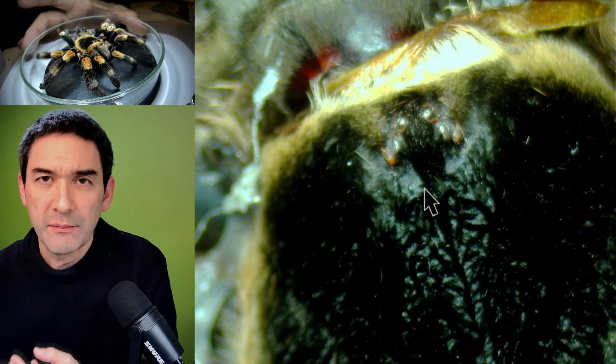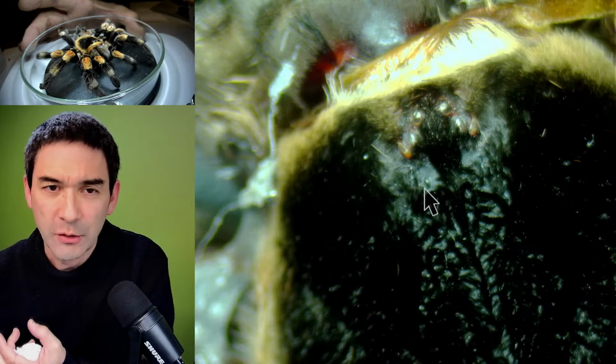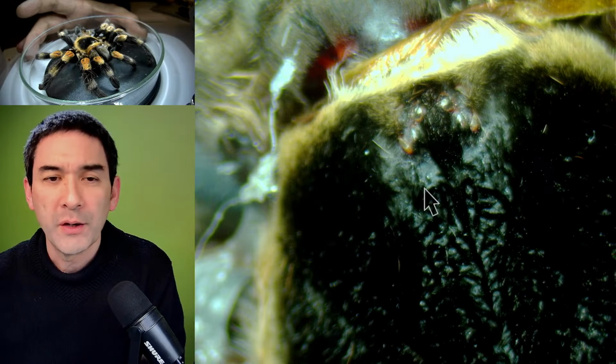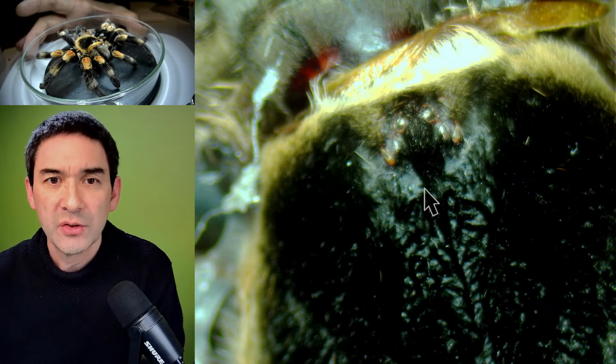Of course, when the spider molted, it took the eyes along. But you should see some kind of an impression in the exoskeleton. No compound structure, that's correct. Spiders have lens eyes, in contrast to insects.